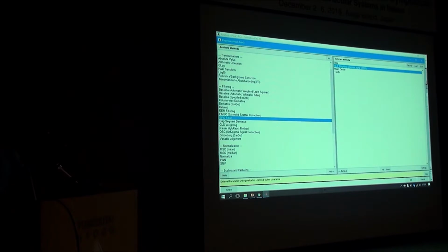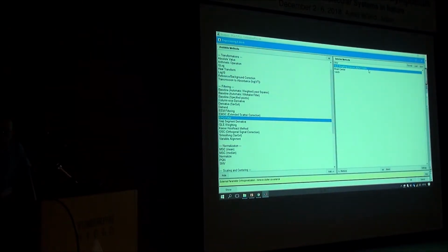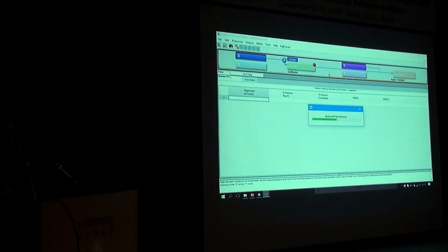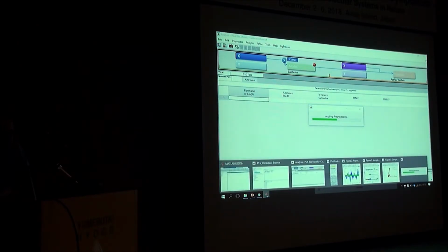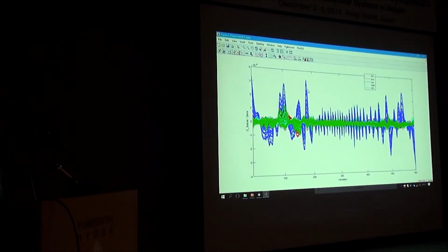Is it possible just to show what happens, for example? Sure. So we got a GLS weighting of 0.0005. So let's reduce it further. What happens is too much deweighting. So you will see the result now. You see? What happens is removing too much information. It's still a clear classification happening, but I believe you're left with noise in certain parts.